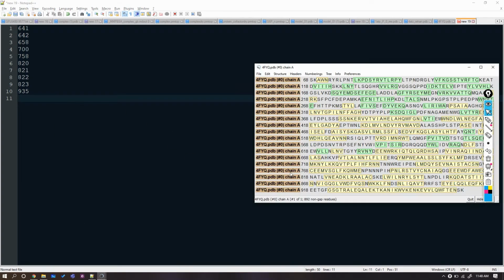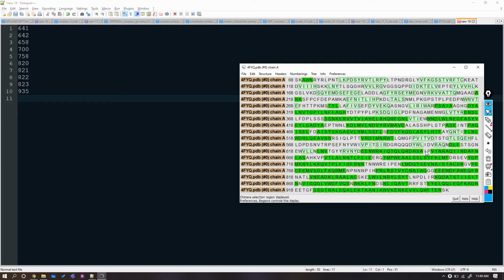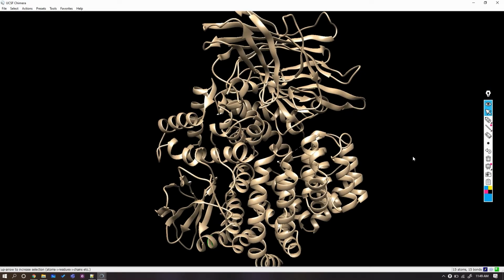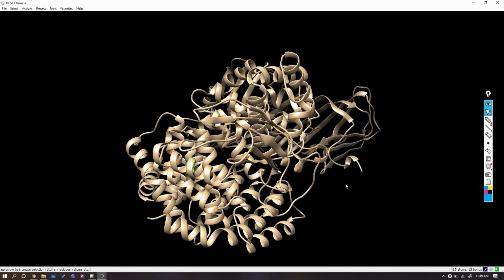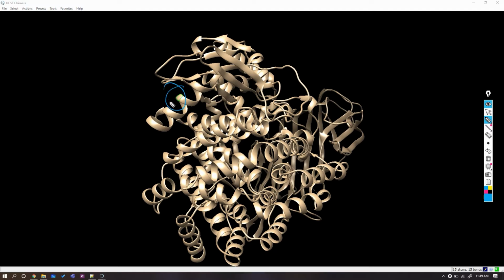Now we will search for the noted duplicate residues. First one is 641. Take the mouse and move over different residues in the sequence window. This is the number of the residue with which the specific row of the sequence starts. In the status bar, you can see the number of the residue over which our cursor is currently hovering. So here is residue number 641. Select it by clicking the residue. After selection, the residue will become green. Now in the structure window, if we look for the green highlighted portion, then we can see the position of this residue. This is the highlighted residue number 641 earlier selected in the sequence window.